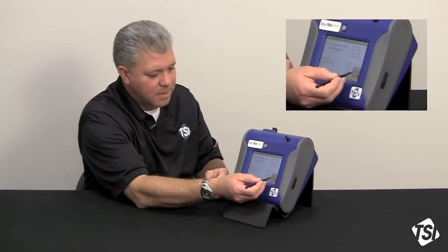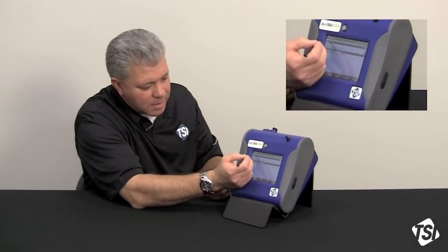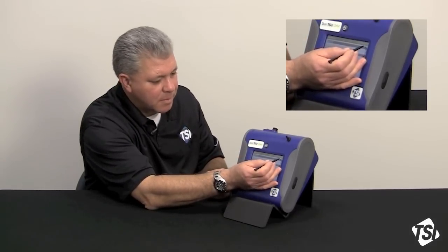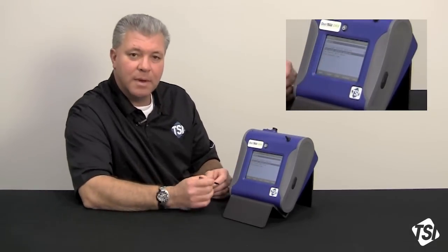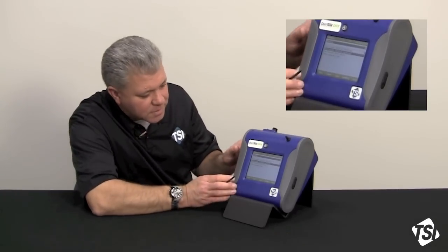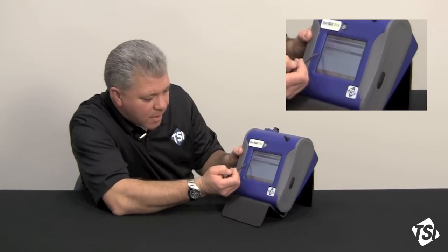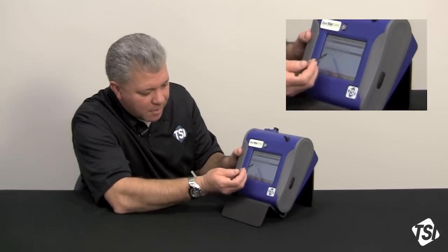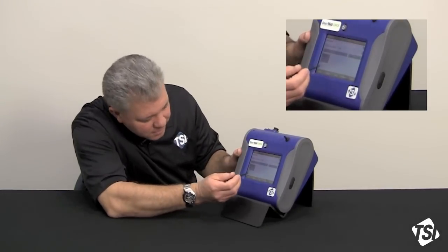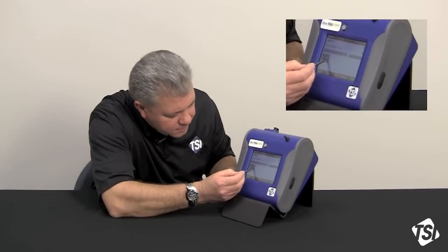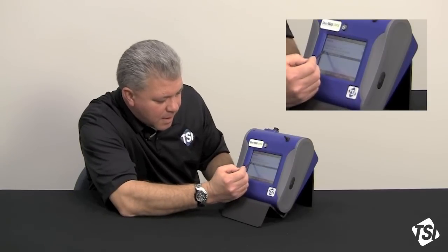I'm going to hit the stop button and I'm going to go back to the run mode. Now, I'm going to click on the upper drop down menu again and I'm going to look at manual logging. In manual logging, I've got a couple of other things that we're going to look at. We've got test length, we've got log interval and time constant. Now, again, our time constant, let's make that 10 seconds and hit the save button and then log interval.